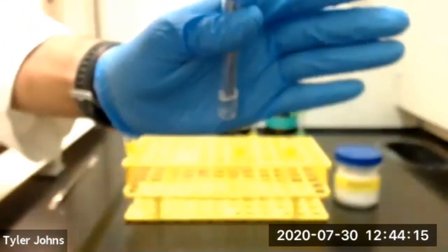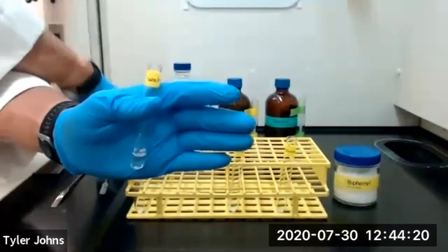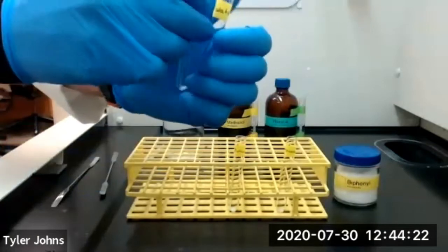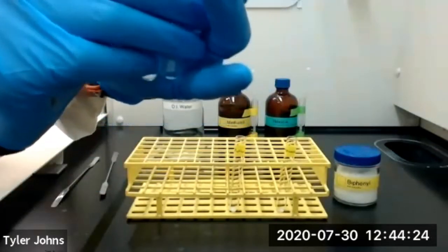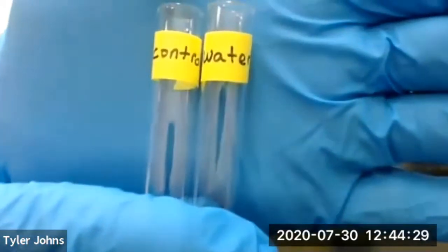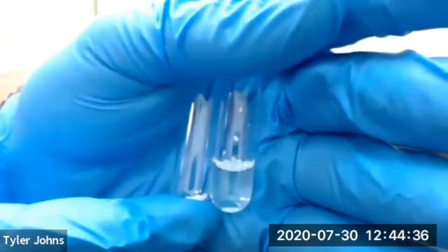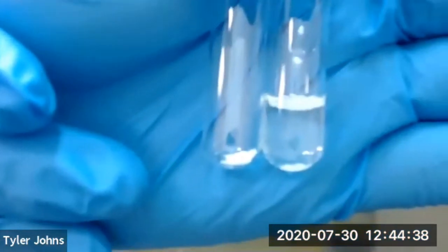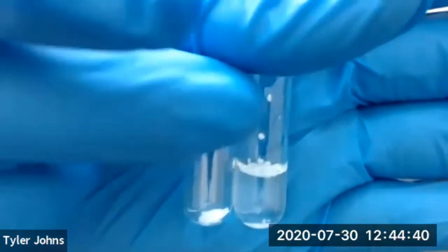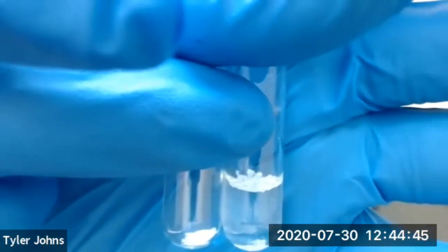So it's been about 60 seconds, so we're going to remove our microspatula and we'll compare the amount of solid biphenyl remaining in our test tube with water to our control. So these are our 2 test tubes. This is our control, and this is our test tube with the biphenyl and the deionized water. Now you can see most of our biphenyl is floating on top of the deionized water.